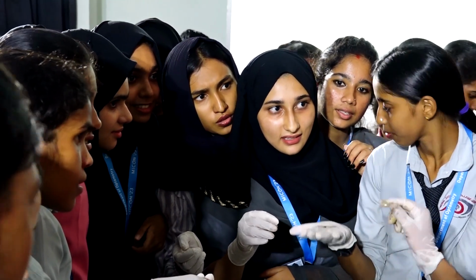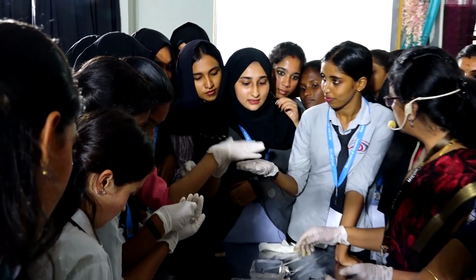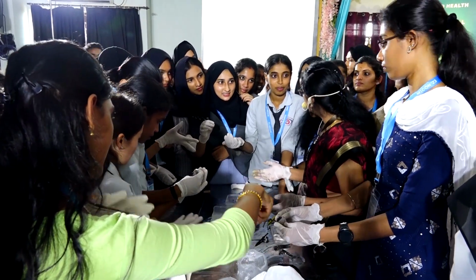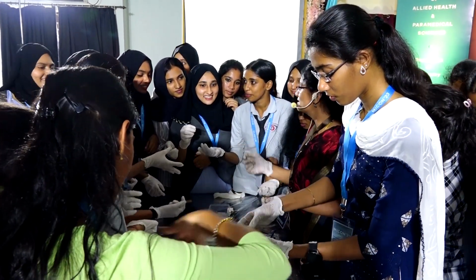Yeah, ora serrata and the ciliary body, which is in the pars plana, which is there at the end. You felt it for the first time? You had imagined it to be like this? No, how did you think it was? You thought it was still hard, not so jelly like.